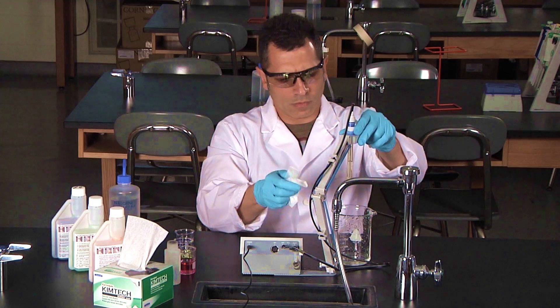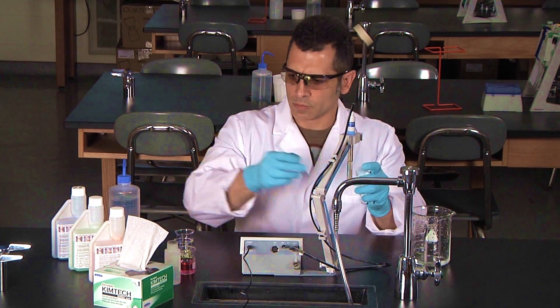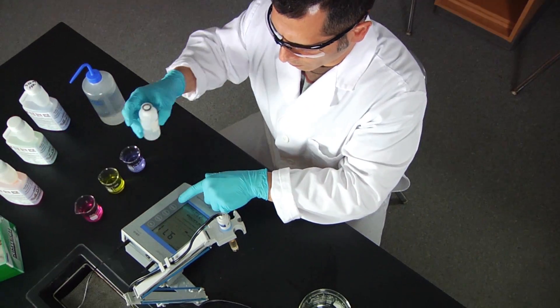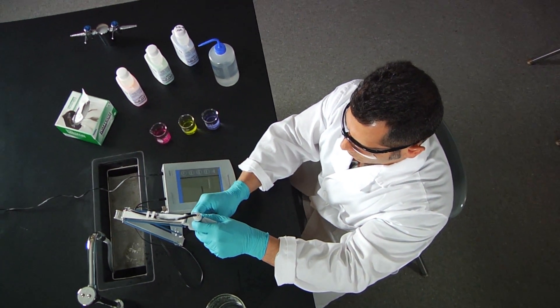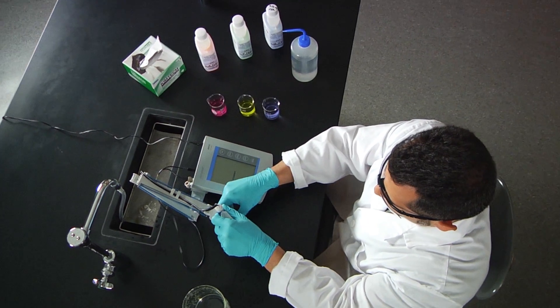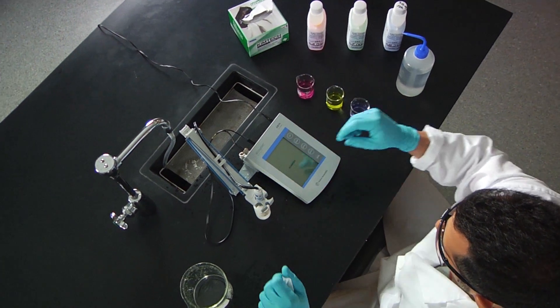Now we have completed our 3-point calibration. In doing so, we have trained the pH meter to perform accurate measurements using three standard buffer solutions. Now the pH meter is ready to be used for a lab experiment.